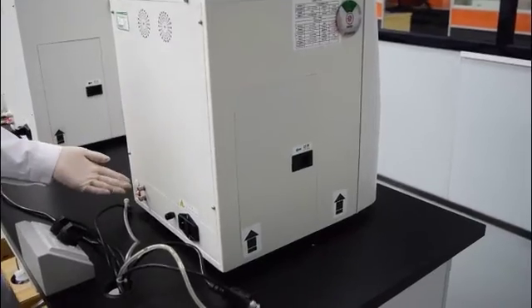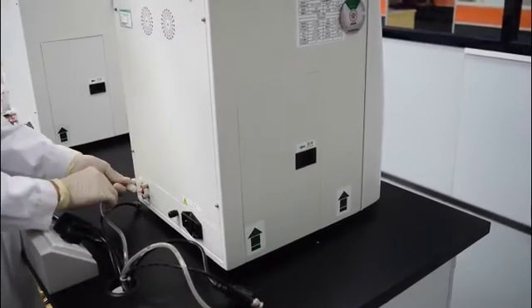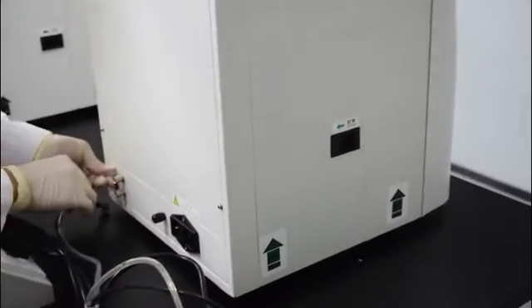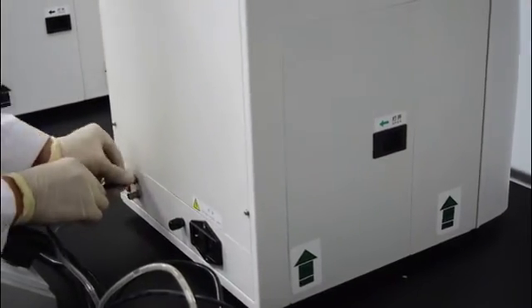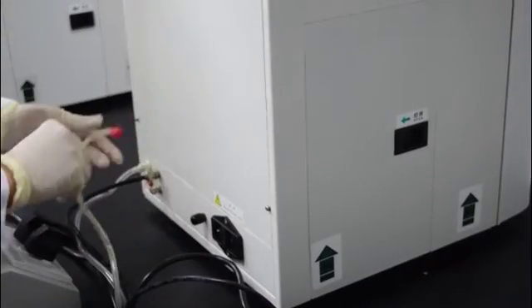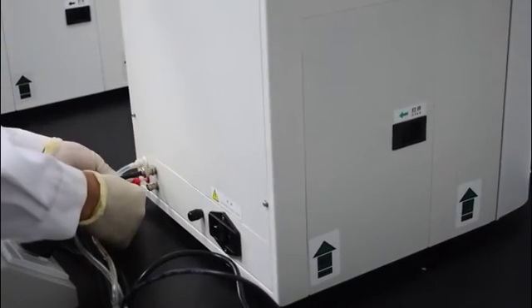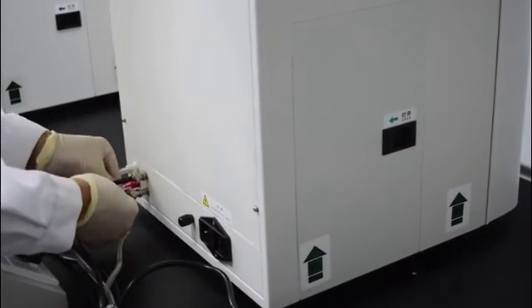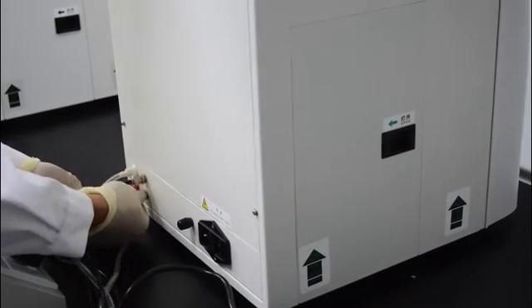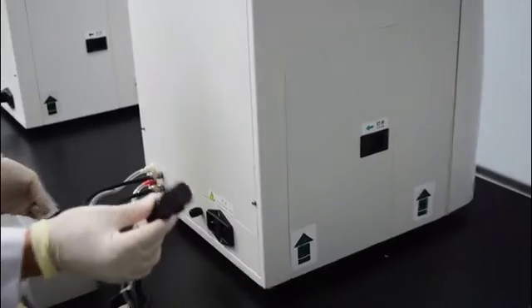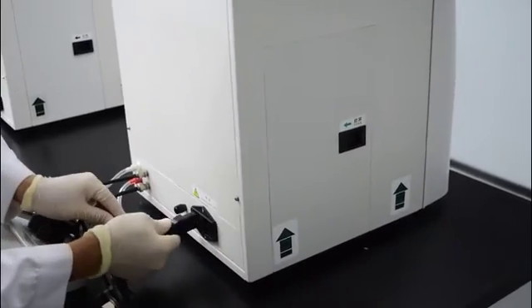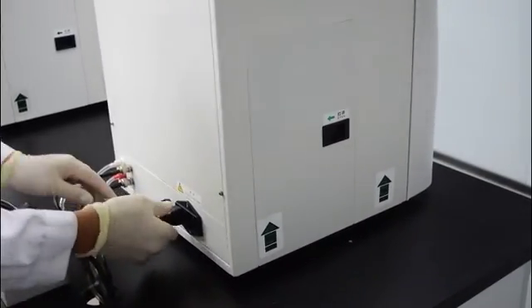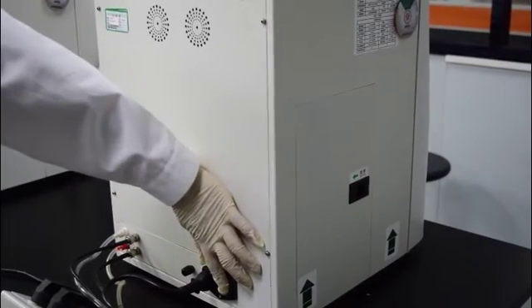Then we can connect the tubes, sensor cables, and power cables. Finally, we can power on the analyzer.